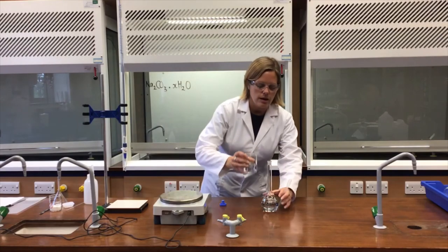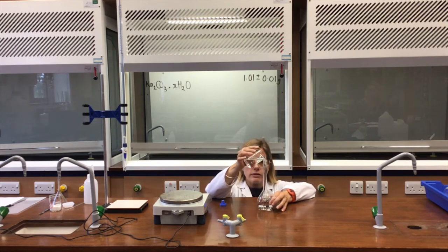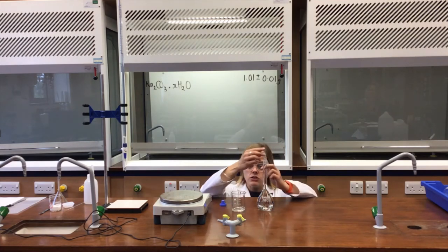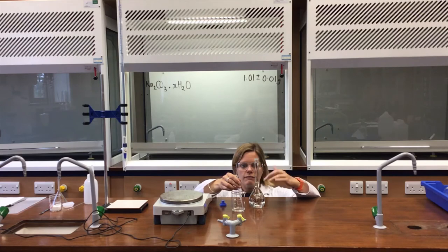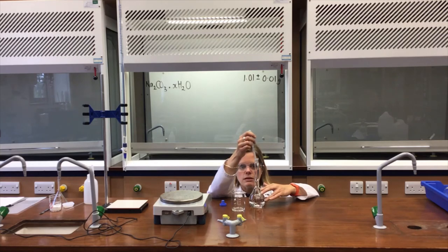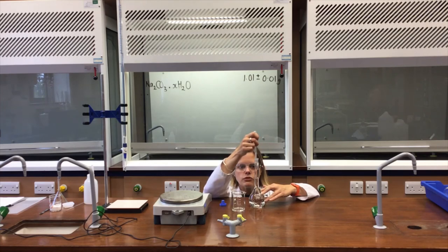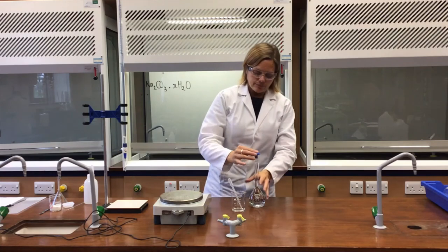I take distilled water and pour carefully, holding the flask so it's less likely to be knocked over. I continue topping the flask up until it's a few centimetres short of the mark, then switch to a dropping pipette. I bend my knees so my eye is level with the graduation mark, the flask sitting flat on the desk, and add drops carefully until the bottom of the meniscus sits just on the line — the same technique as with a pipette or burette.